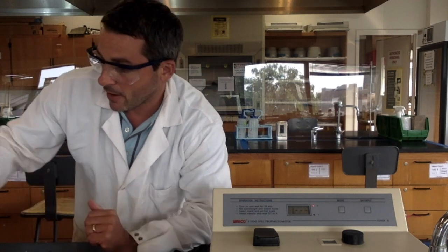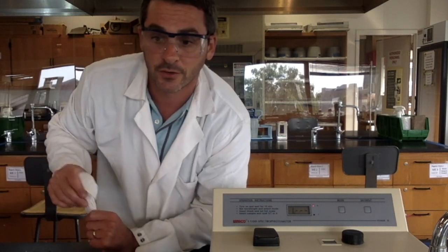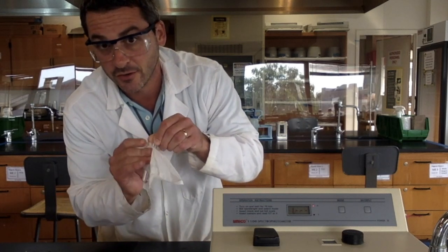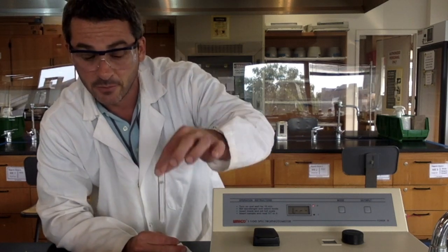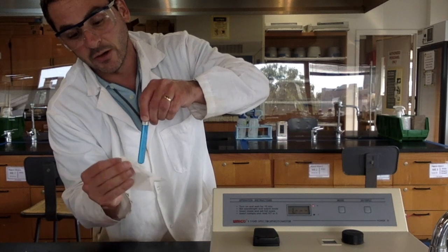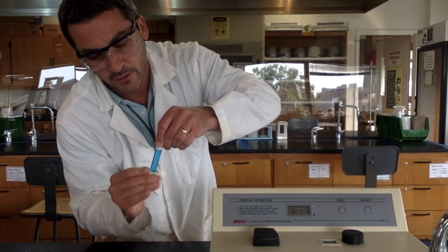All right. Now, when you're preparing your cuvettes, there are a few things that you want to remember before you run your sample. First off, you need to clean this cuvette. Fingerprints absorb light, dirt, dust, whatever, absorb light, so you want to make sure they're nice and clean. And once you do that, if you handle it from the top, that would be beneficial because then you're not making it dirty and you don't have to clean it every time. Now that I've cleaned these up, you also want to make sure there are no bubbles in there. Bubbles scatter light, and that will affect your readings and your accuracy.